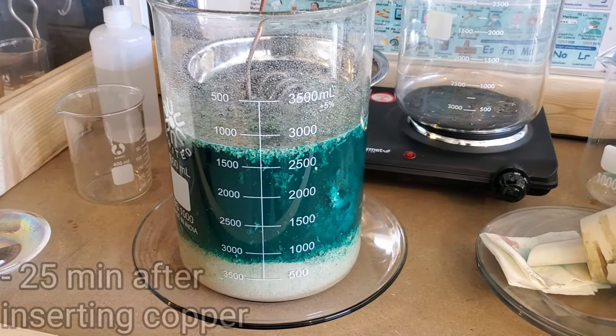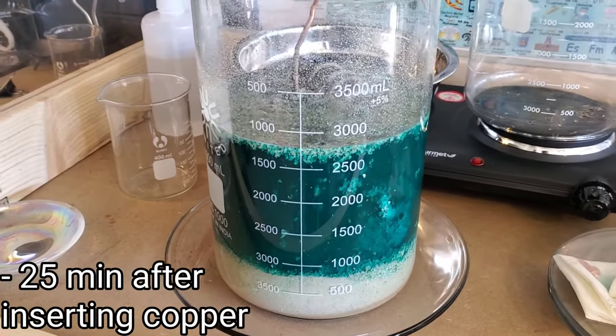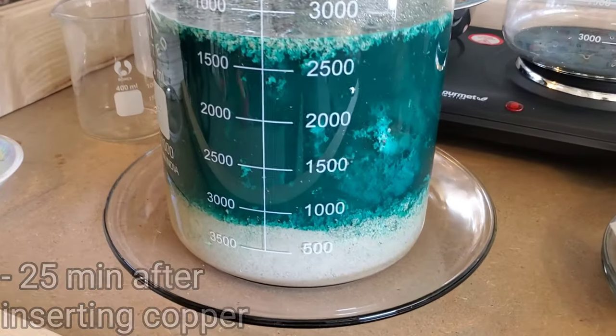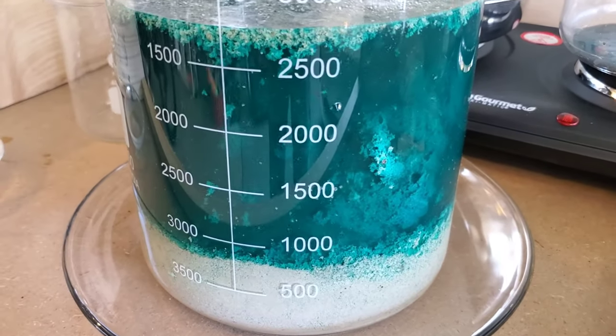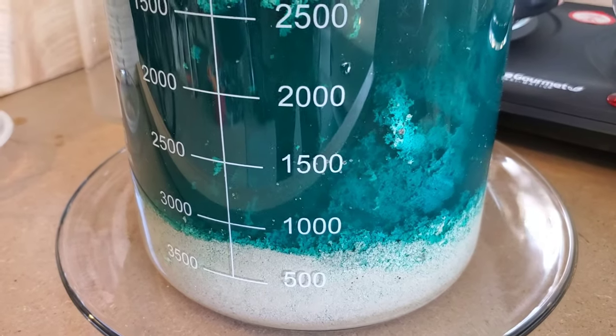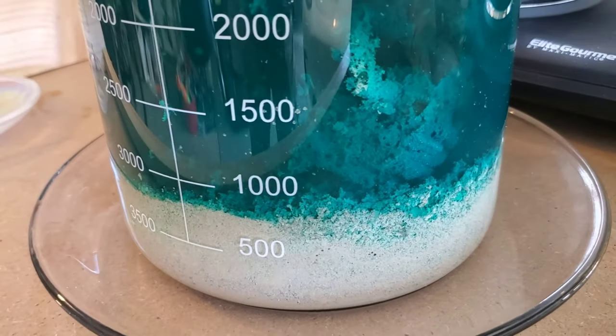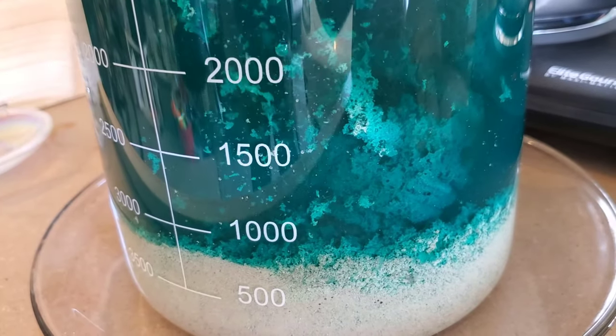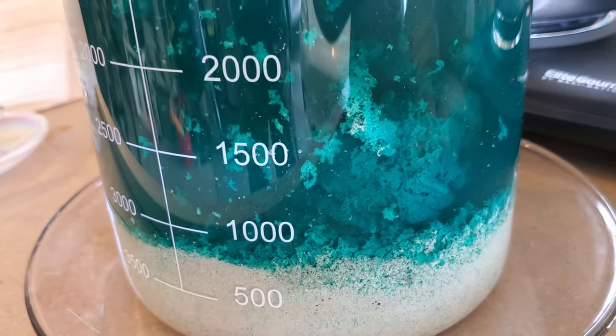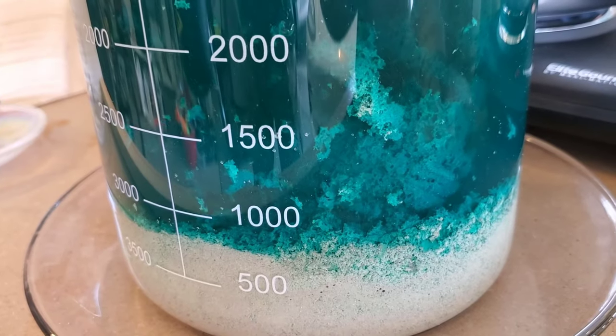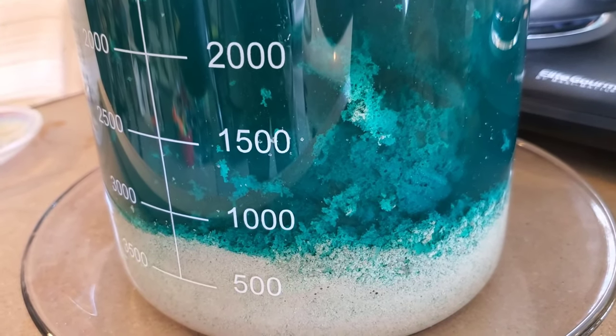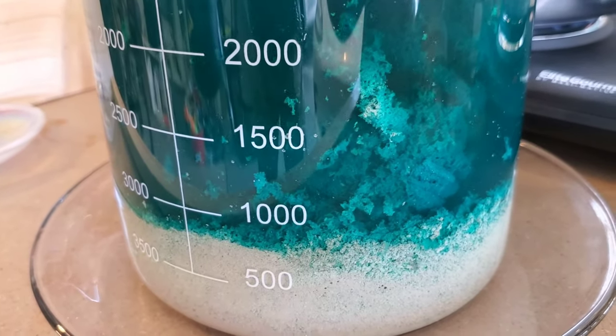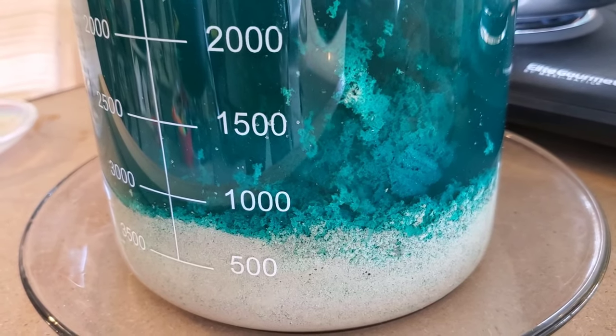All right, we're doing pretty well here. I'm already pretty happy with this yield that it looks like we're getting. You can see it's still active. Silver crystals. Nice, pure silver.